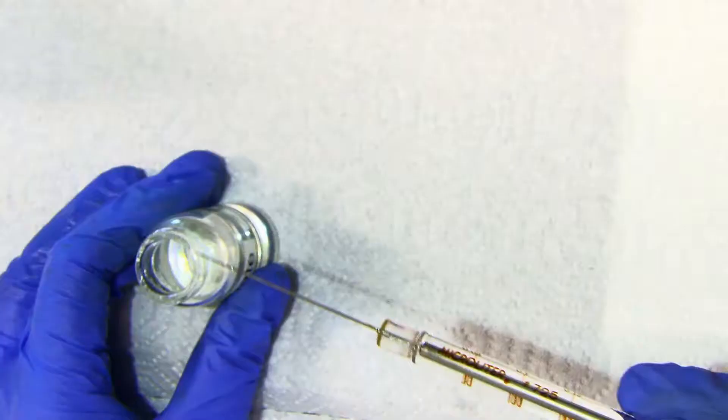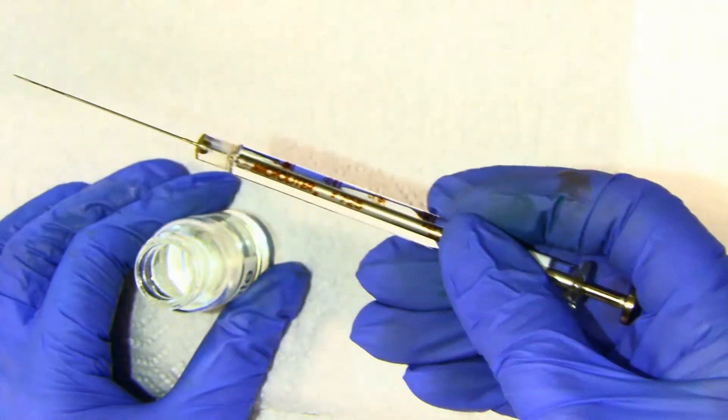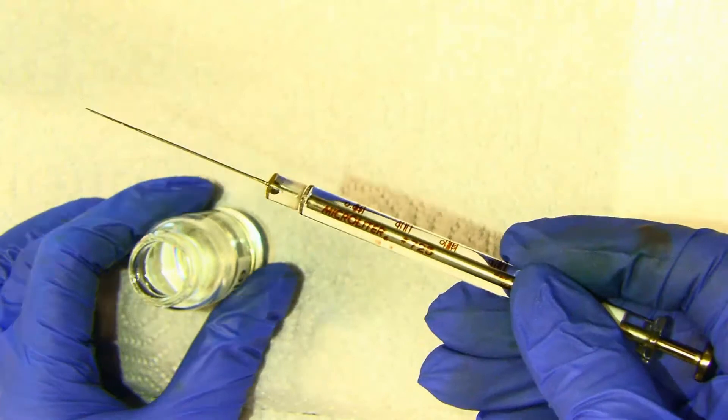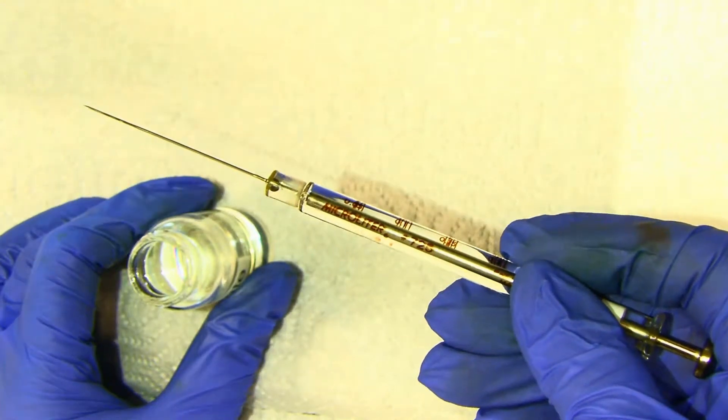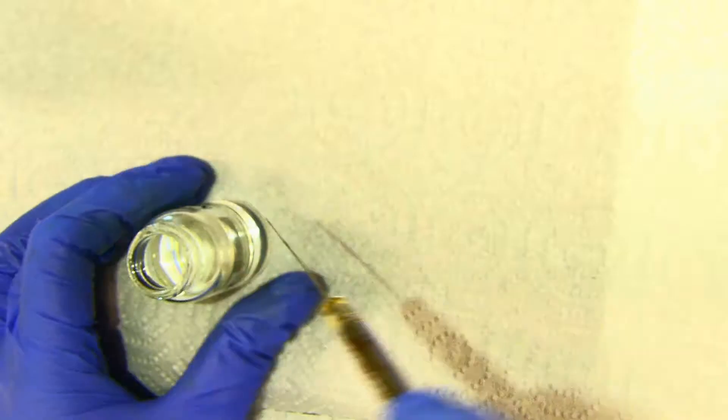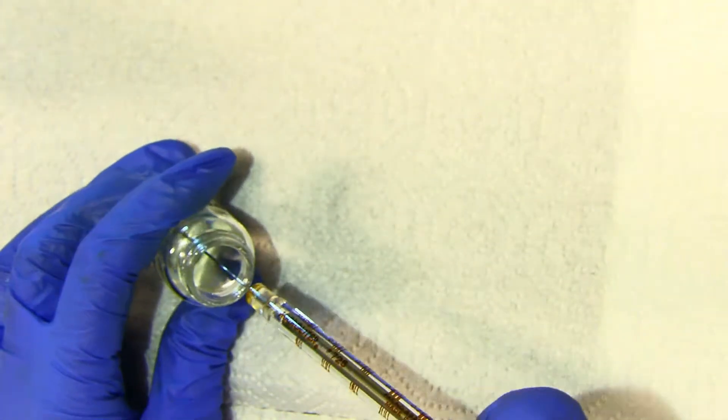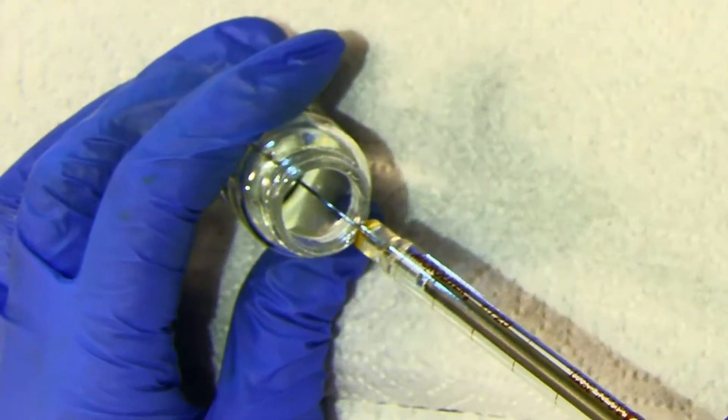Now, we'll use the syringe to obtain a sample. This syringe is a very small bore, and so you can expect a little time lag when you pull liquid up in it. It will delay behind your pull. Stick the needle under the liquid and pull and wait.